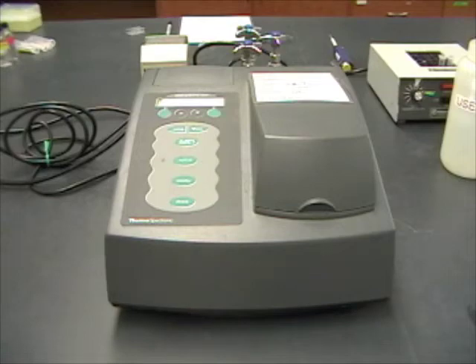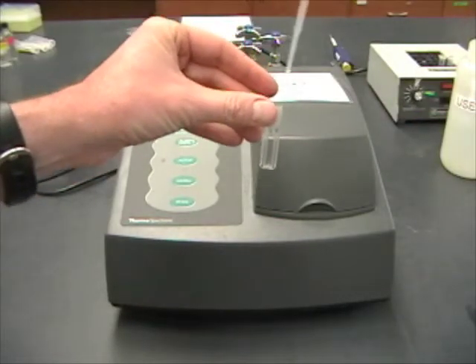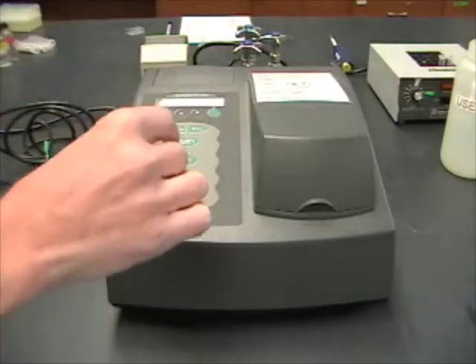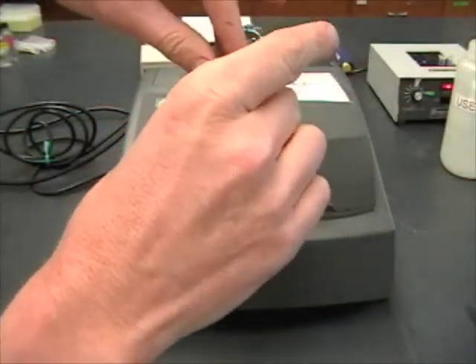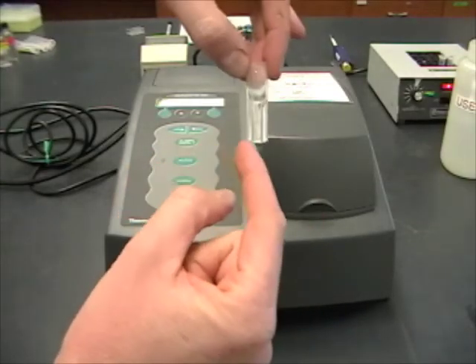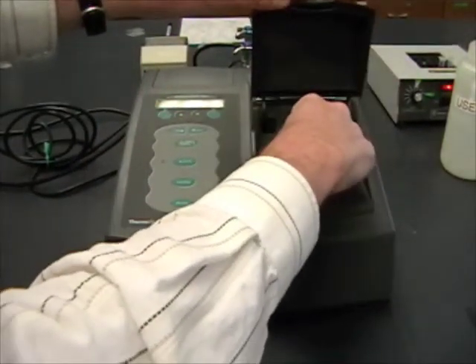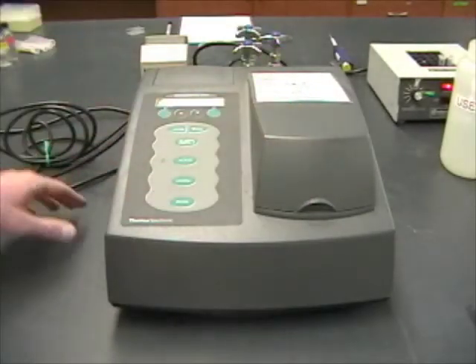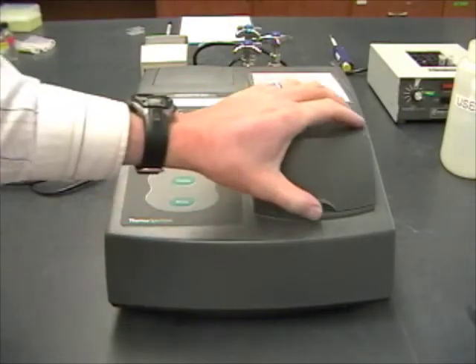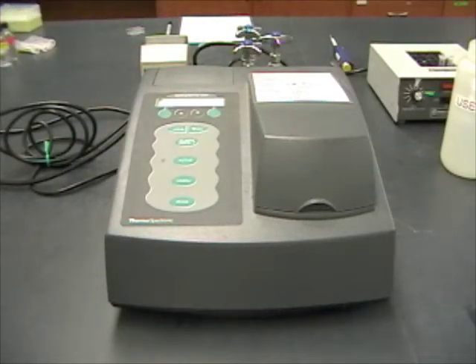So, now it's time for one of the first measurements that we're going to do on the spectrophotometer. Remember, at the start of each time point, I used my pipetter here to take one mil out of my flask and put it straight into this little cuvette. The purpose of doing that is to detect how many bacteria are present here in the cuvette. So, of course, I'm going to want to wipe it off to make sure there aren't any fingerprints on it. And you'll notice that the cuvette can go in here two ways. You want to look for the side where there's the little clear window going right down the middle here. So, the spectrophotometer gets blanked with water. And then you put this in so that the light will pass through that clear window. And then you read the OD600. And that's going to give you an indication of how many cells are present in your tube. Of course, over the time that you're doing the experiment, the bacteria are going to keep multiplying. So, it's important to calculate how many bacteria are in there to get an accurate measurement of the enzyme activity.